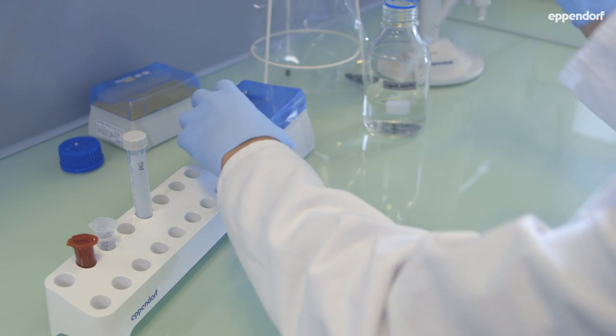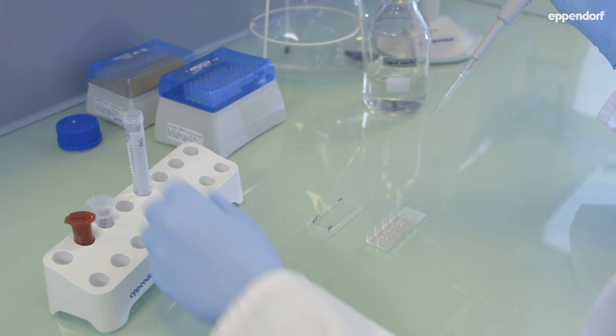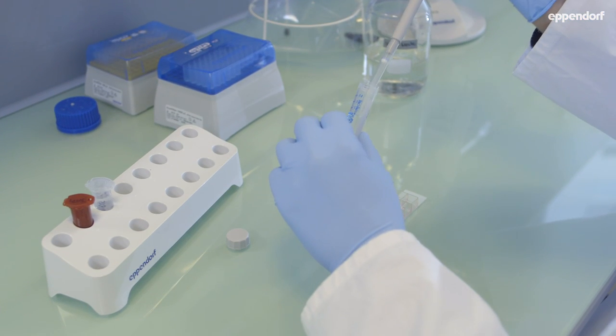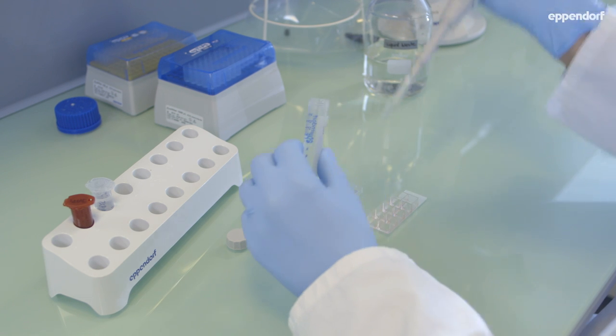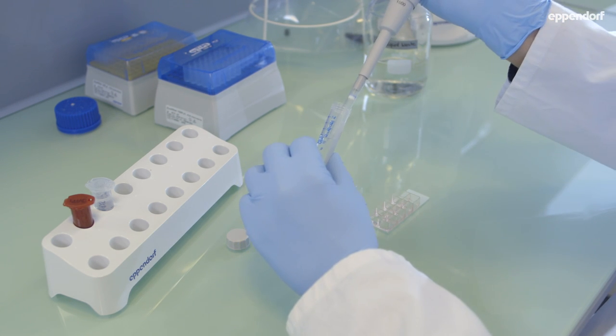There are several ways of applying fluorescence to a cell. When you stain the cells or label them with fluorescent antibodies, the concentration of fluorescent probes and incubation times vary depending on the cell type and probe that you use.